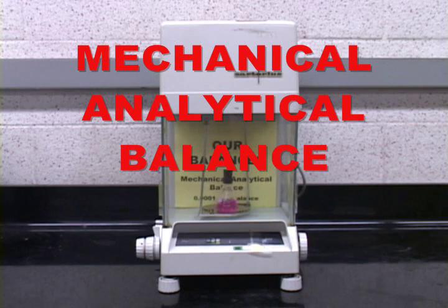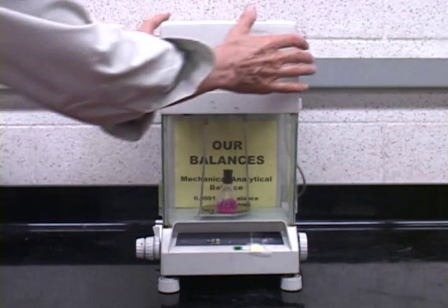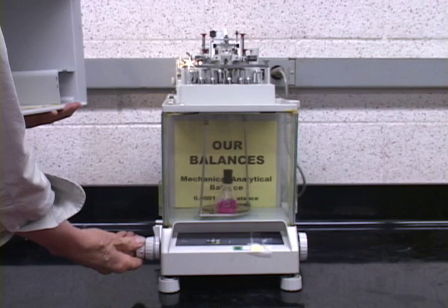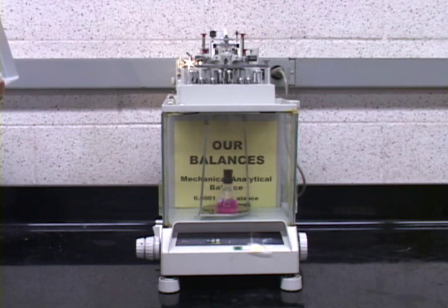Finally, on a couple of occasions, you will use a mechanical analytical balance. Now, this is an analytical balance, which means it weighs to 4 decimal places. It is a mechanical balance, which means that it uses weights to counterbalance the object being weighed. The weights in this balance are in the top part here, where these are the weights, and they are dialed up by the dials which you have on the balances here. It is an obsolete balance, and it is fairly complicated to get started, so it probably is better if the instructor shows you how to use it. So see your TAs when you need to use this balance.